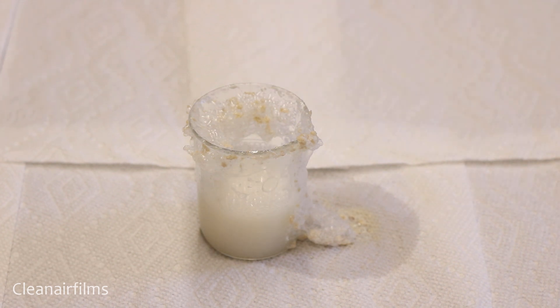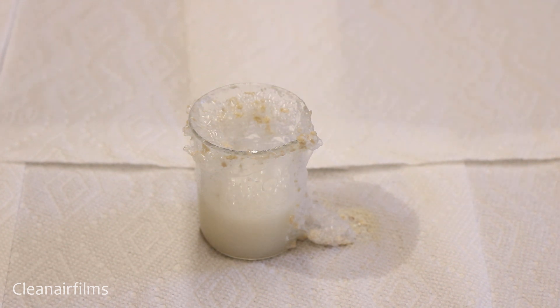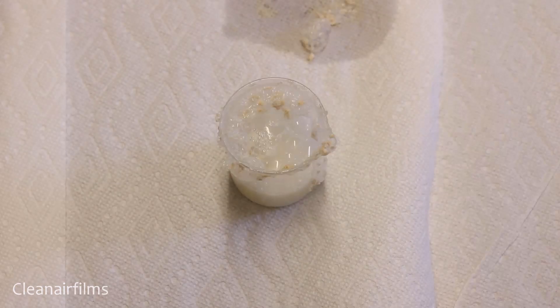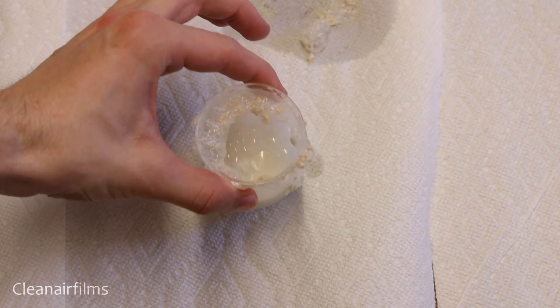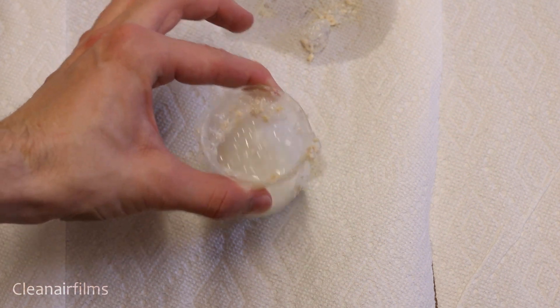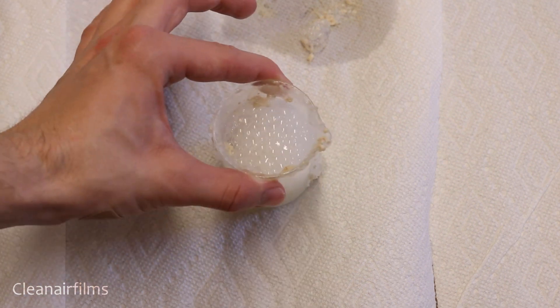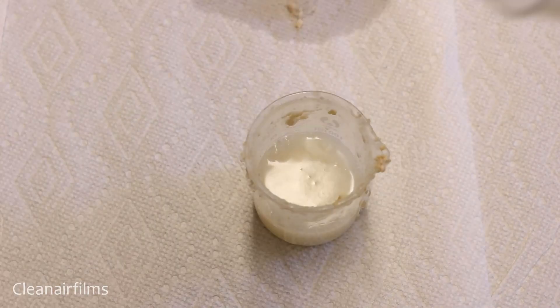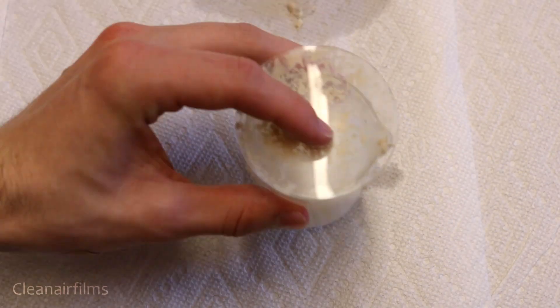We can add 25 milliliters more of hydrogen peroxide to test this. We could decompose the entire bottle of H₂O₂ with this one quarter teaspoon of catalase or yeast. The exact method of how catalase works is not completely understood and rather complicated.